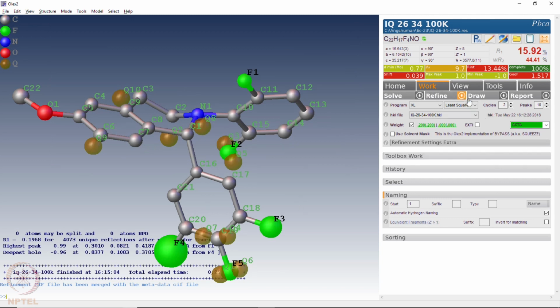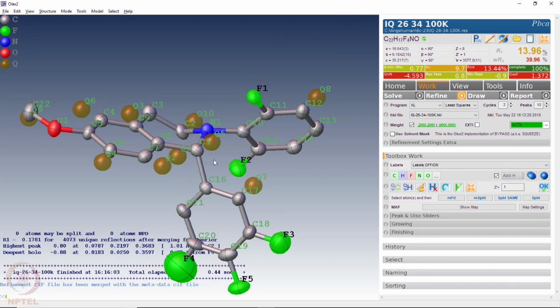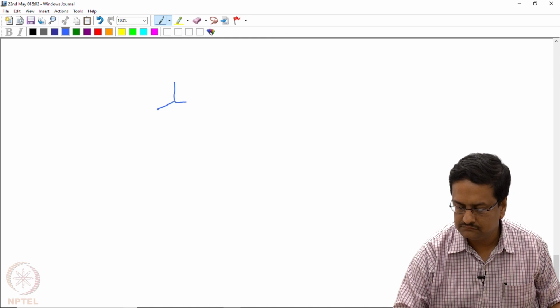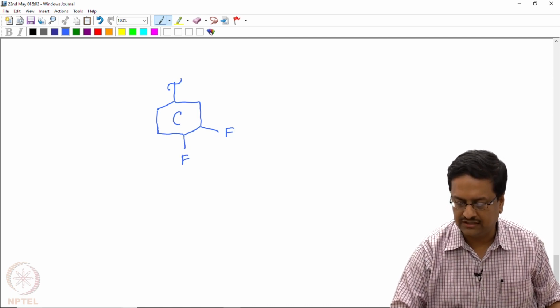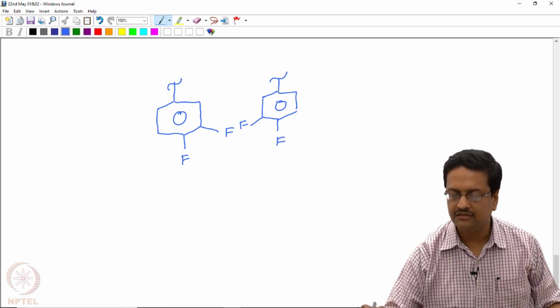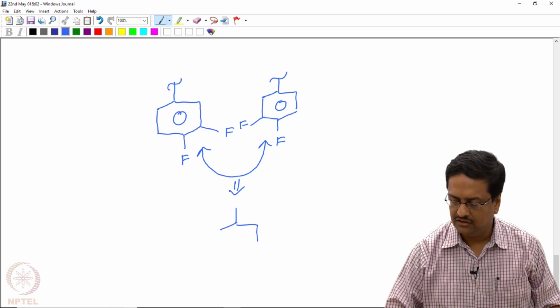So at the moment we do nothing. We just continue the refinement as usual. We do it with anisotropic refinement, and we recognize that these fluorines are disordered because they are now rotated by 180 degrees. So what is happening in this particular case is that we have a phenyl ring with two fluorines at these two positions with respect to the attachment, that is position 3 and 4, and this ring being rotated by 180 degrees in two different locations, the fluorines are appearing on either side. The asymmetric unit represents an overall average of these two structures or these two conformations.